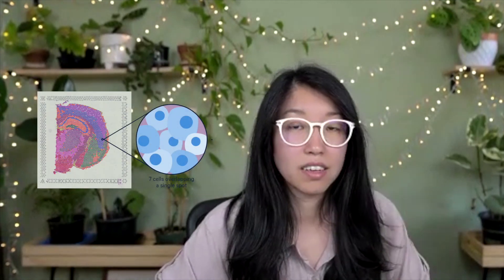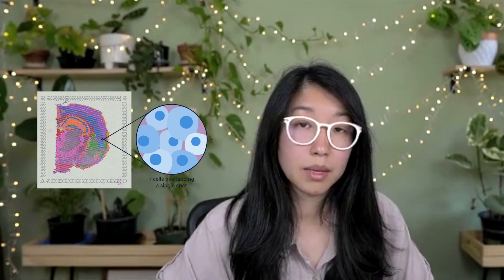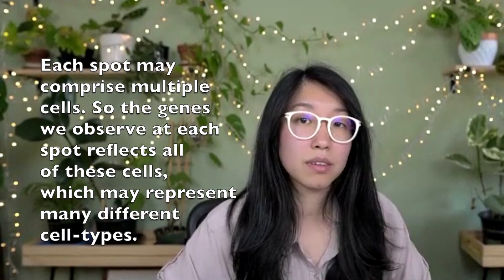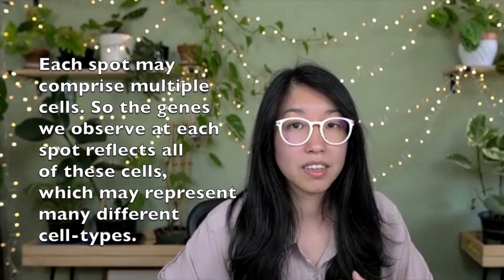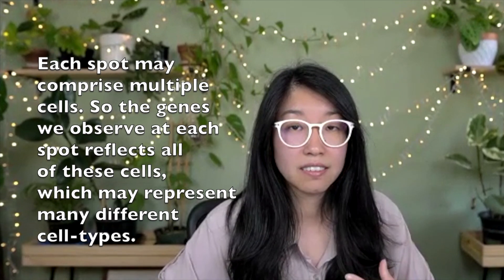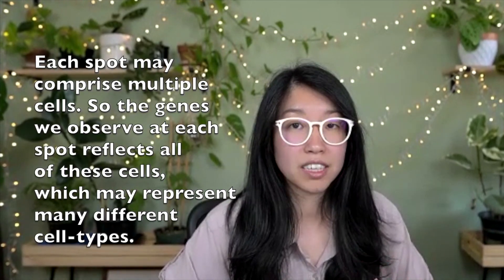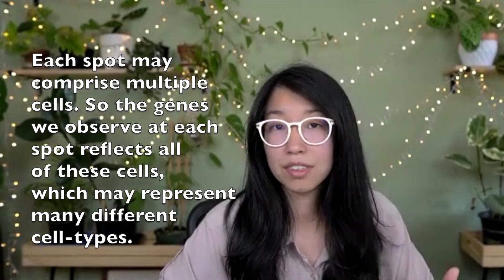10X Visium is one of these spatially resolved transcriptomics technologies that allow us to perform full transcriptome profiling at 55 micron spots tiled throughout the tissue. Keeping in mind that a cell may be only 10 or so microns, each of these 55 micron spots may therefore comprise multiple cells, and as a result, the genes that we observe at each of these spots are also going to be a reflection of all of these cells, which of course may represent many different cell types.